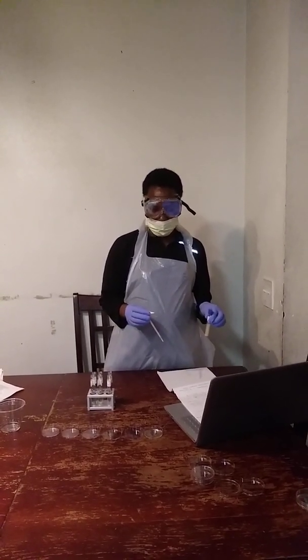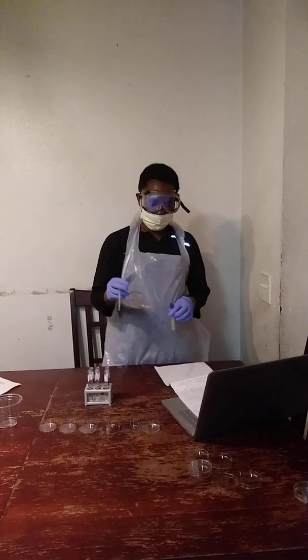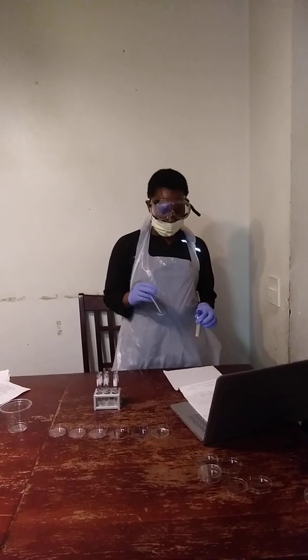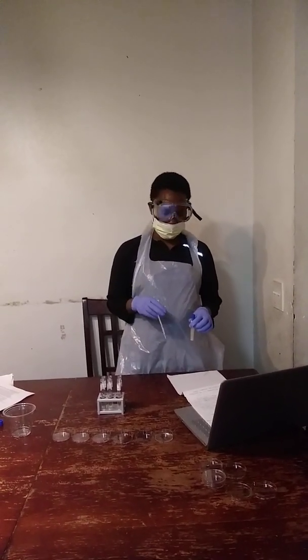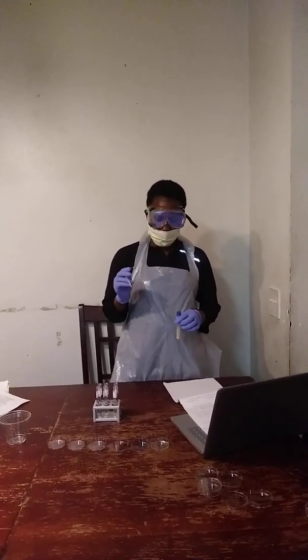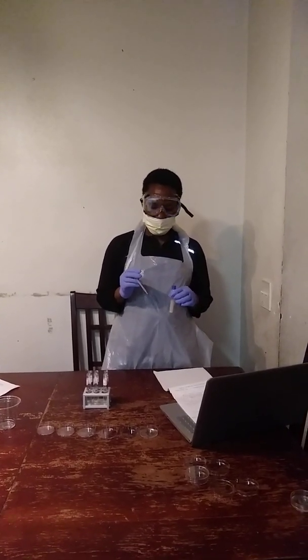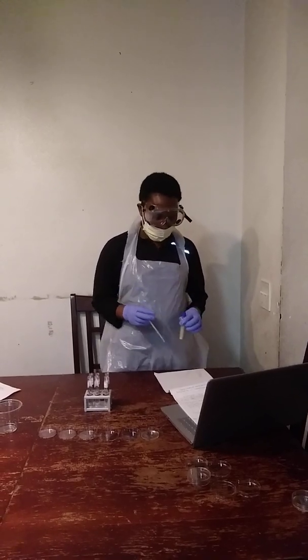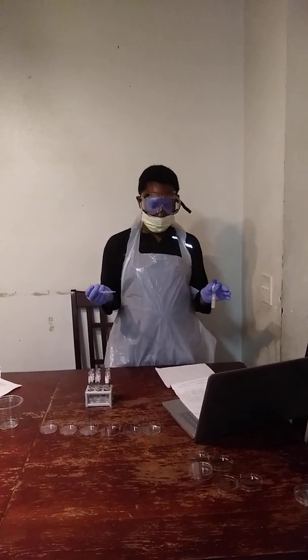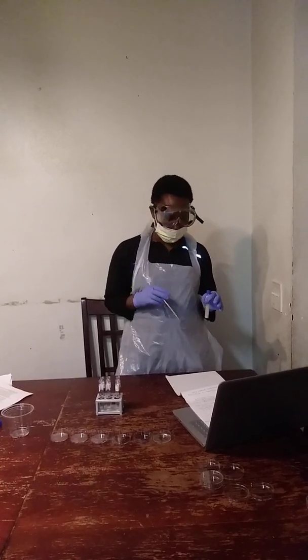so I can do the microbe counts. So dilution of bacteria culture is done so that when you spread a sample onto the agar plate containing nutrients, only 30 to 300 bacteria will grow and produce colonies. And a single bacteria divides multiple times, forming a colony, which is called a colony forming unit. Based on a colony forming unit on a plate, the number of bacteria present in the original culture is calculated. That is what I'll be doing.